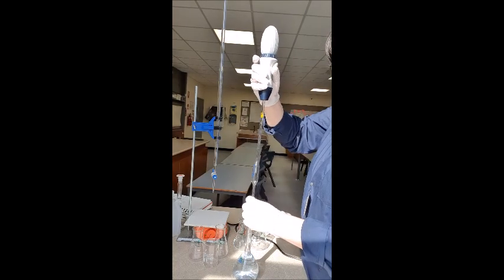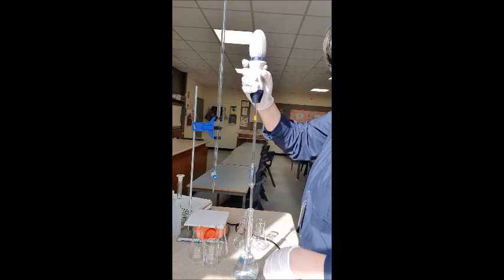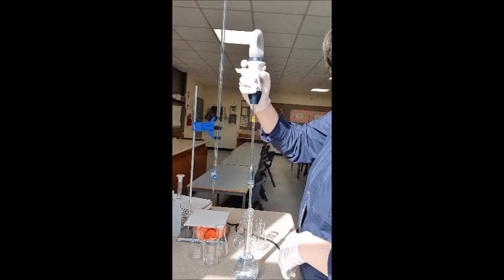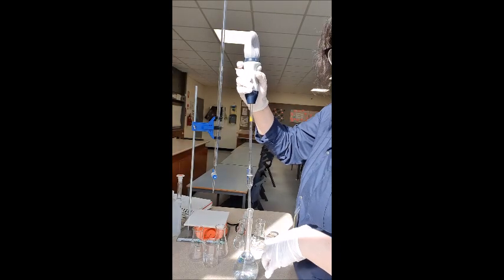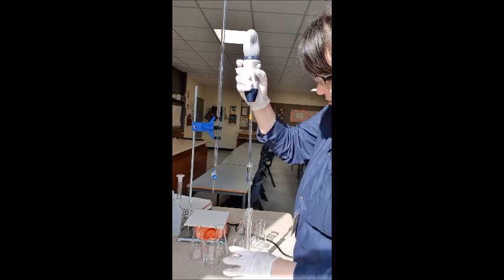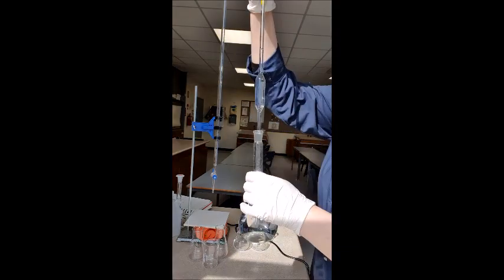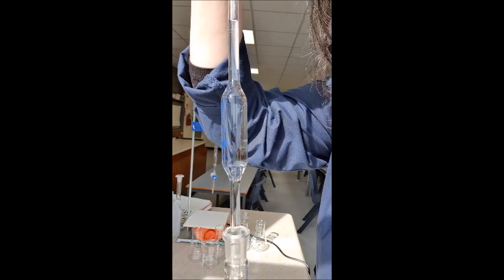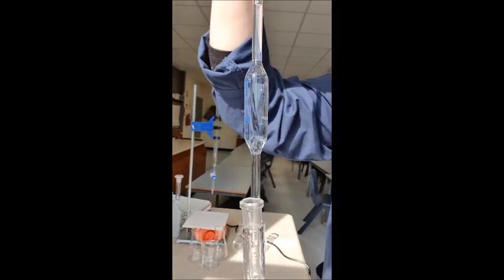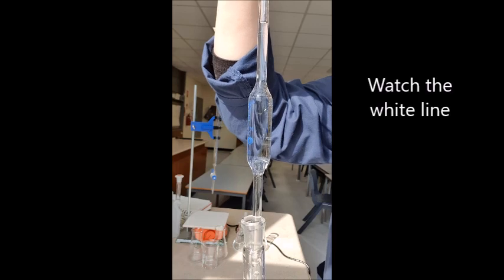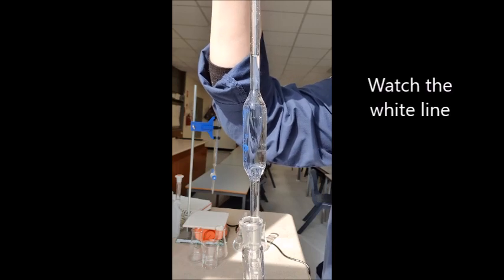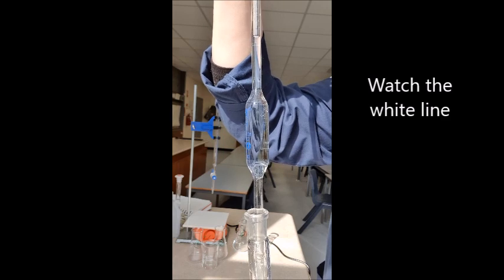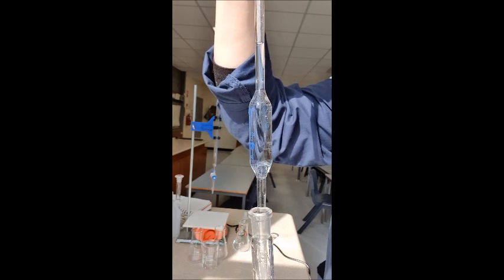I have a waste beaker here with me that's labeled waste. Very important to label all your beakers so you don't accidentally use it for something else. All these pipettes have been rinsed but just in case in analytical chemistry we always have to rinse everything we use with the solution that we're going to use it with. So if you can see it's very pale. See that really pale line? I need to get the meniscus just above that. See it can be a bit hard. You can overshoot it.